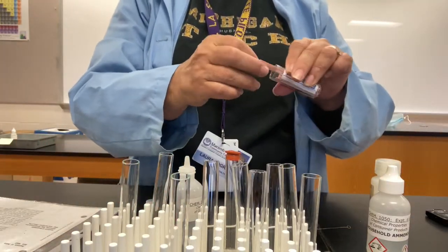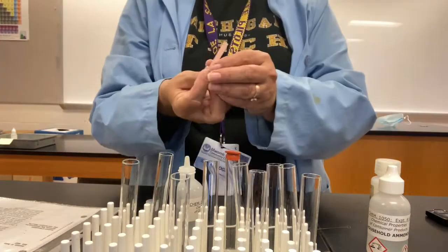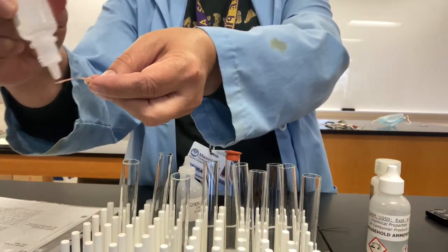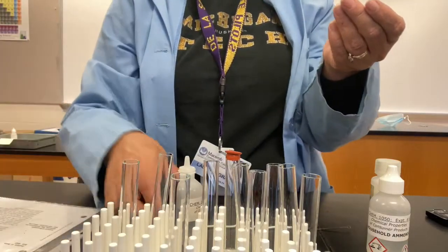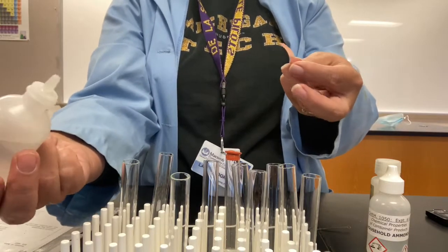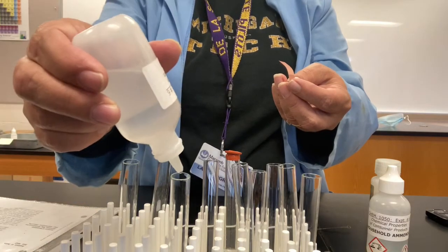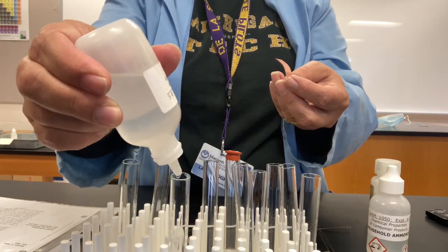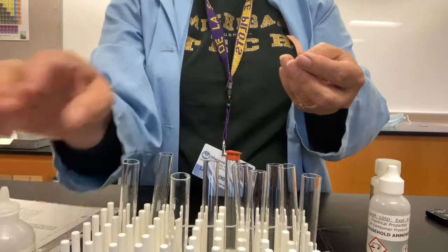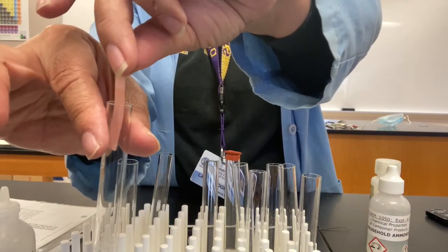And then we're going to test to see if that is successful by doing the litmus paper test that we did earlier. So I'm going to wet this litmus paper with some distilled water. Then I'm going to add the 10 drops of sodium hydroxide to our test tube containing the ammonium chloride. So here we go. 1, 2, 3, up to 10. React a little bit, then put the litmus paper into the mouth and wait.